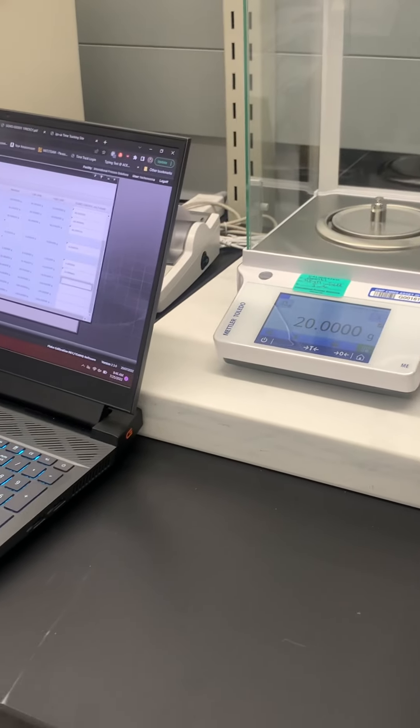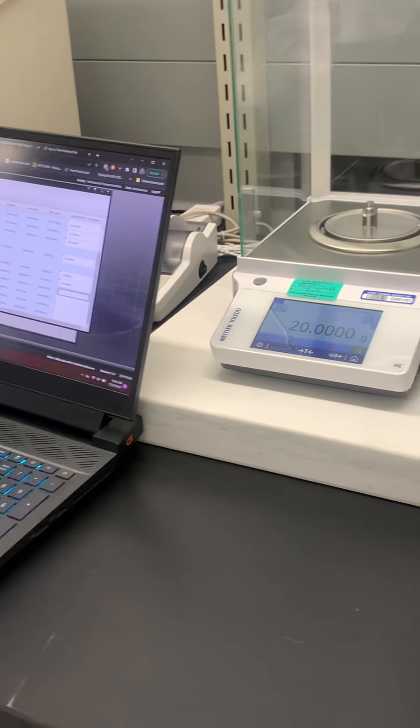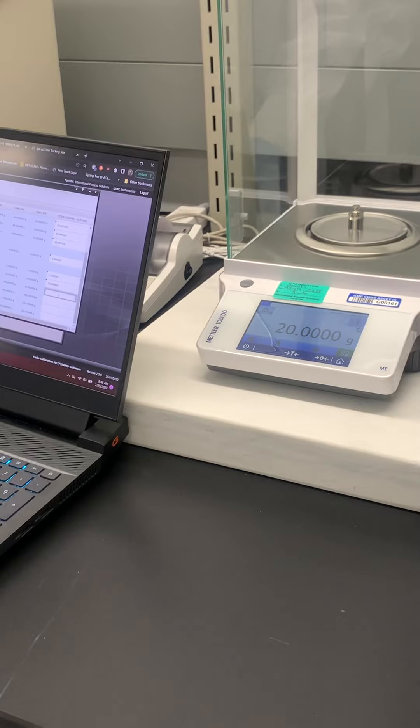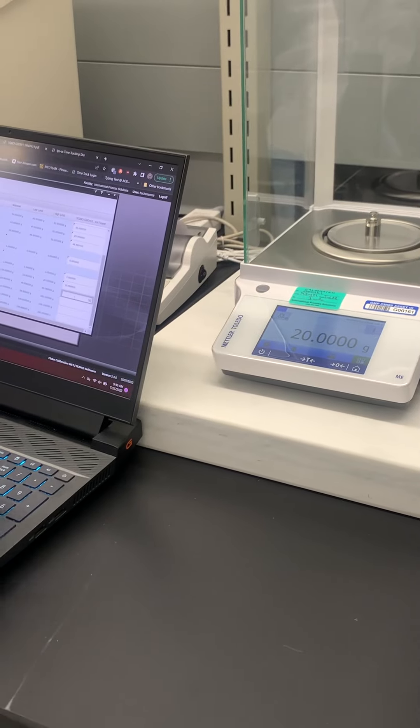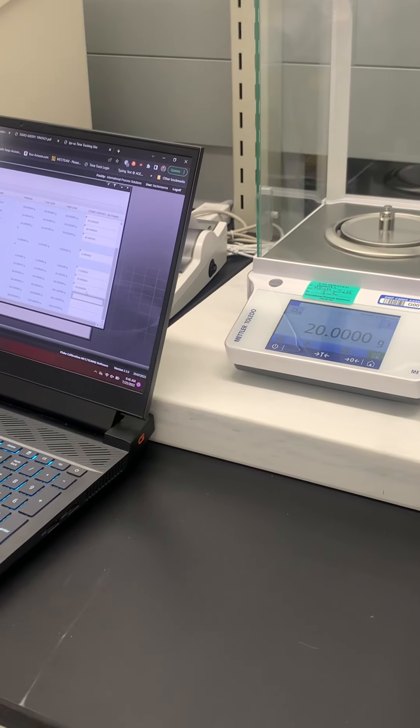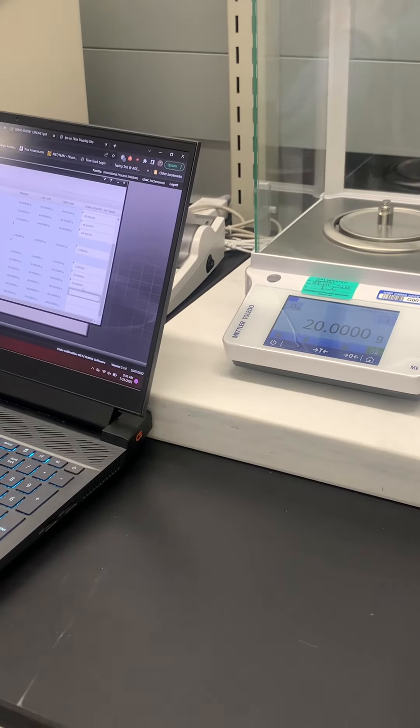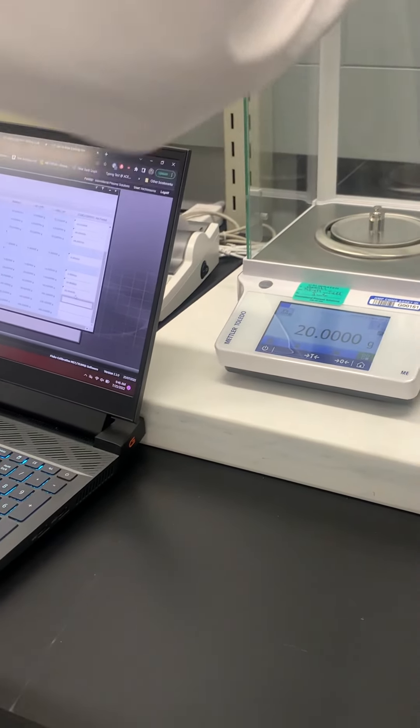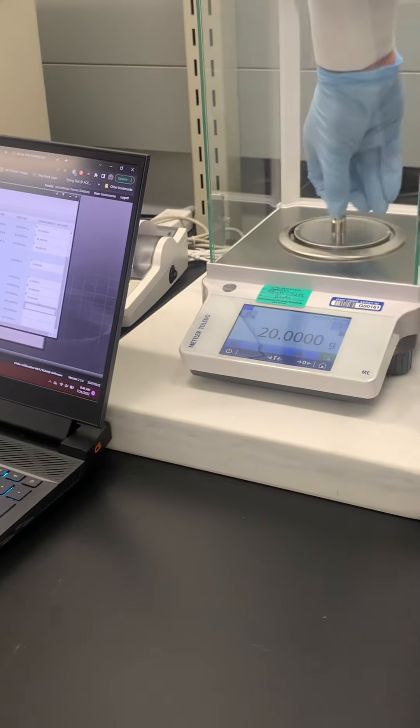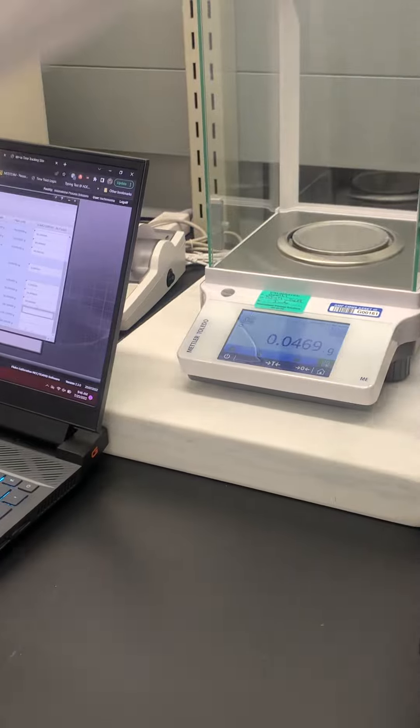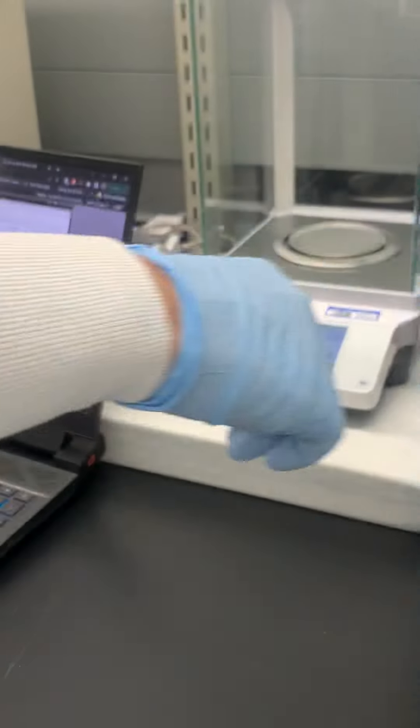So I already did a center test for my 50 gram, it was 50.0. Maybe reuse that information twice if you want to, if you want to be cheeky about it, because sometimes you have to do 48 different weights.